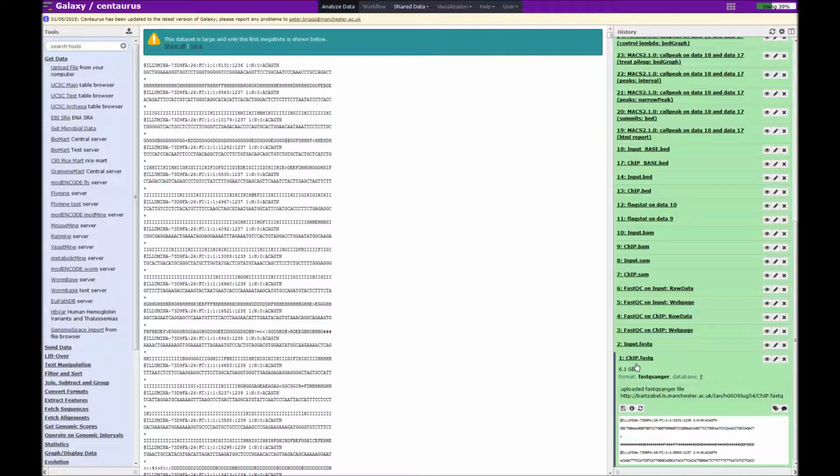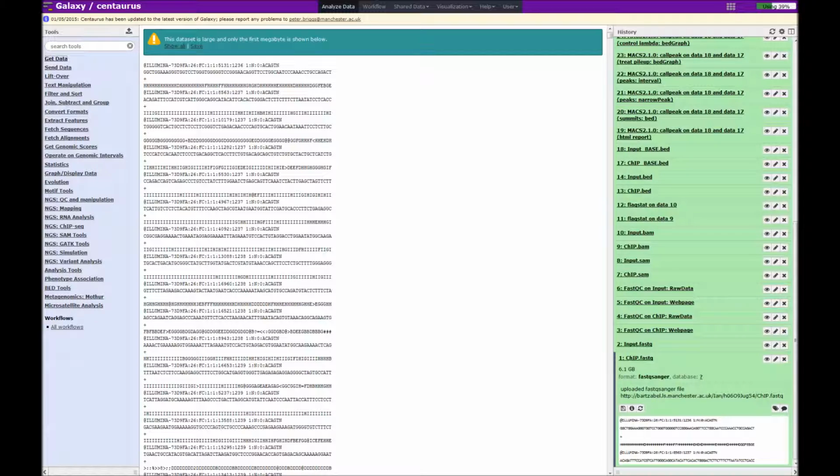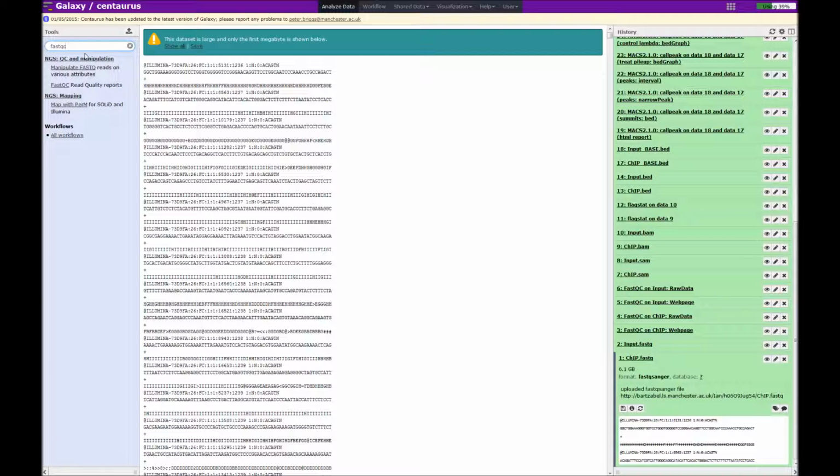With our ChIP fastq file and input fastq files loaded, we can now begin the quality control process using fastQC. Now, to find this in the Tools menu, we can use the Search Tools function because it can be quite hard to find the tool you want. So we can start typing fastQC, and we can see that it's installed under NGS QC manipulation.